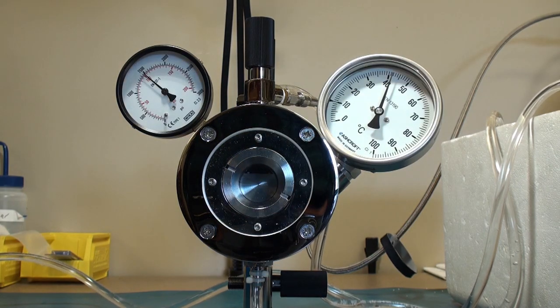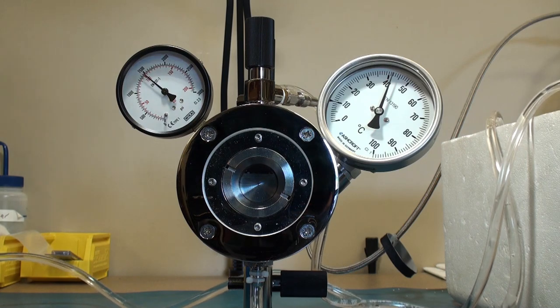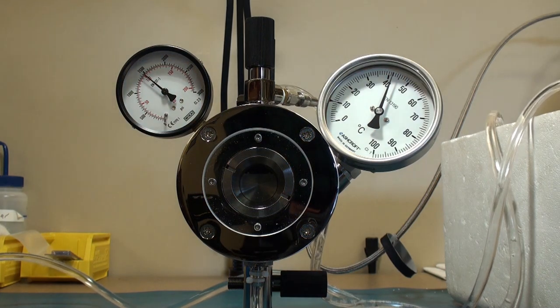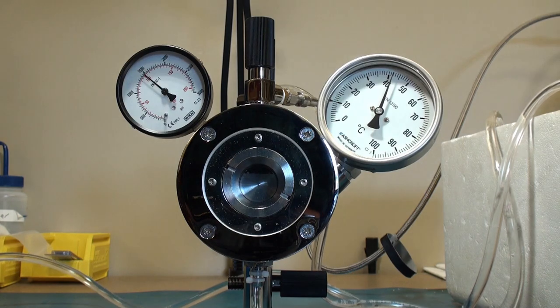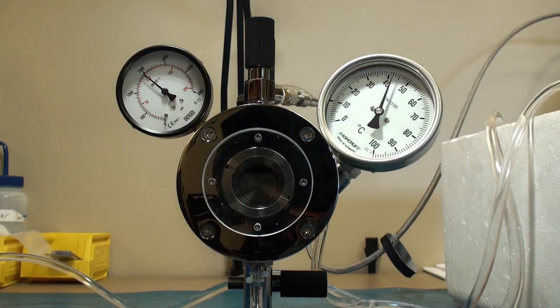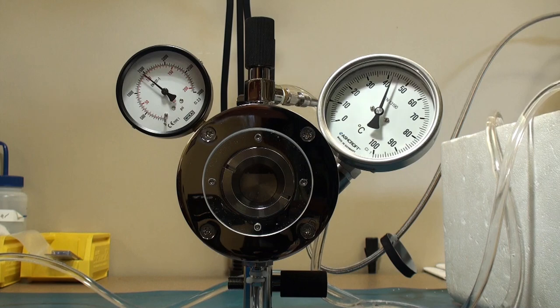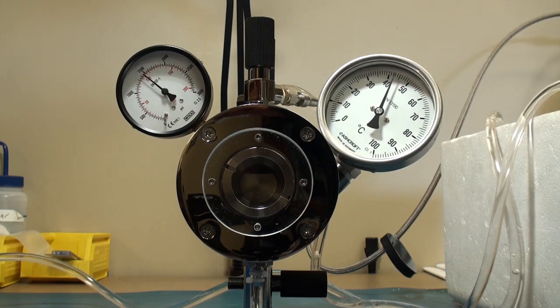That is really the upper limit you should never exceed. I like to give everybody a little bit of headroom over the safety burst membrane.